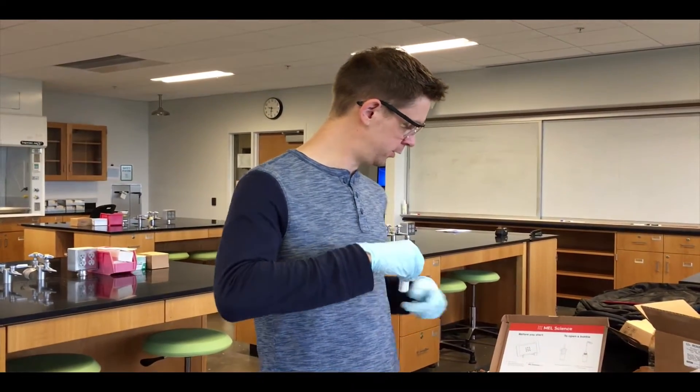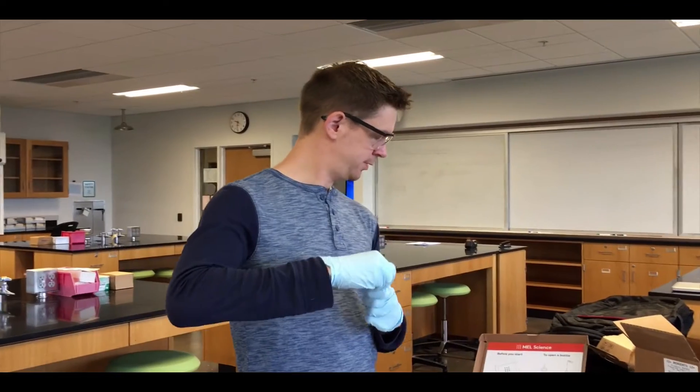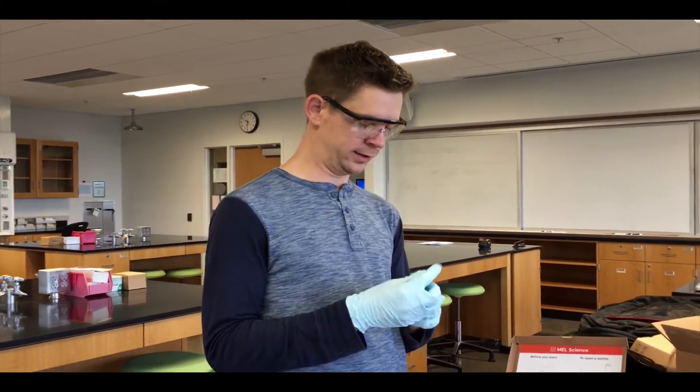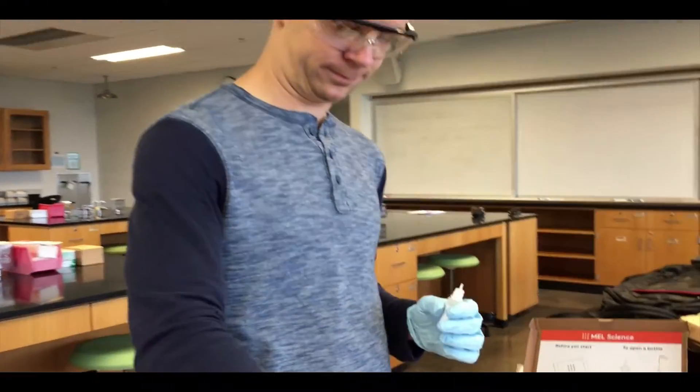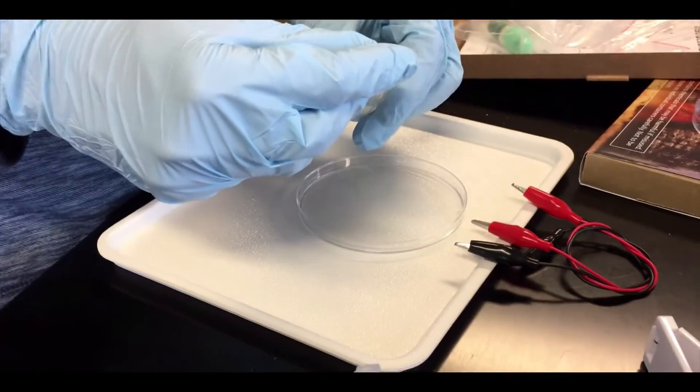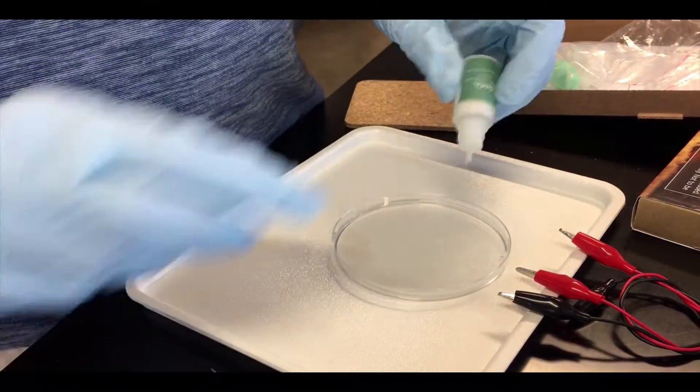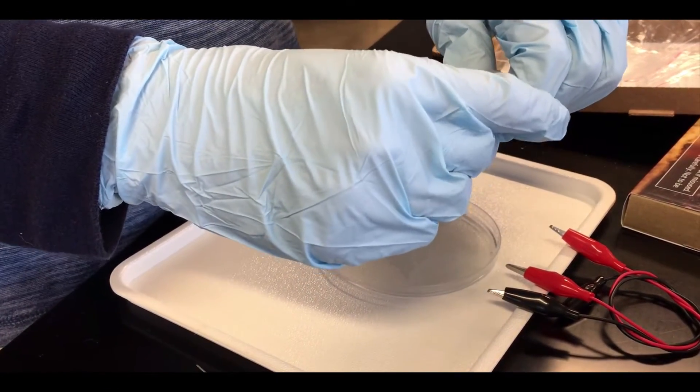The first thing we're going to do is fill up the bottom of this petri dish with tin-2 chloride, and I'm going to zoom in on the setup. Poking in the cotton plug, getting it all out of there.